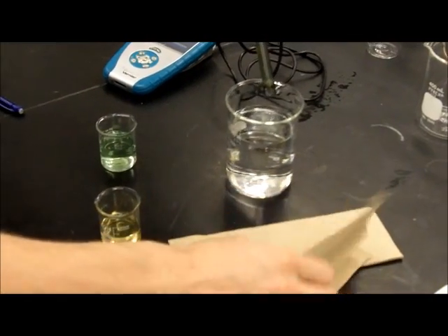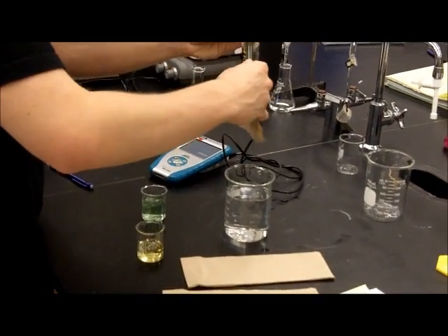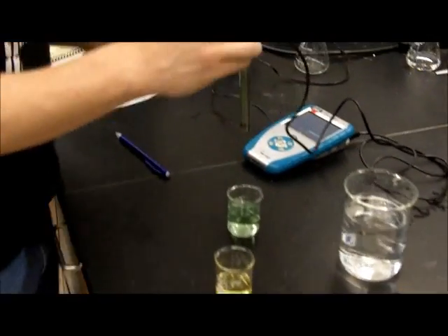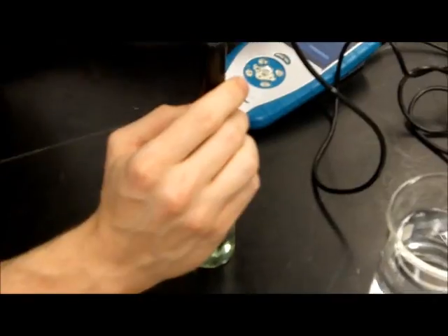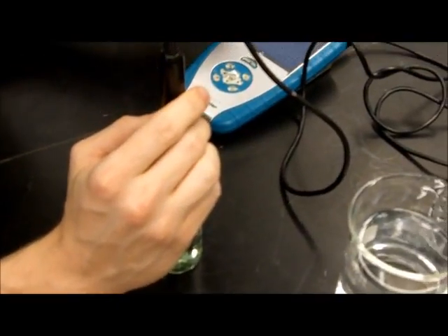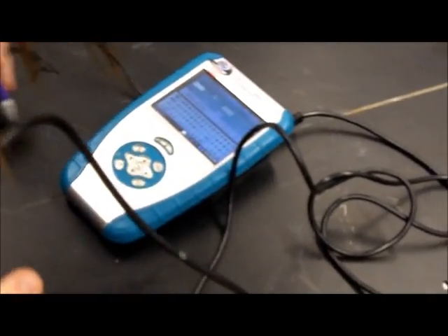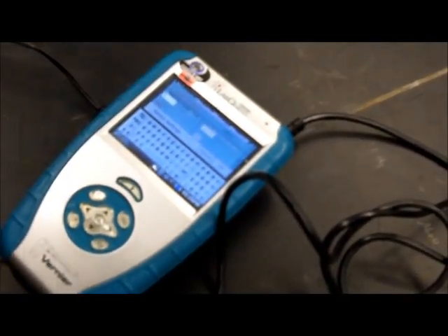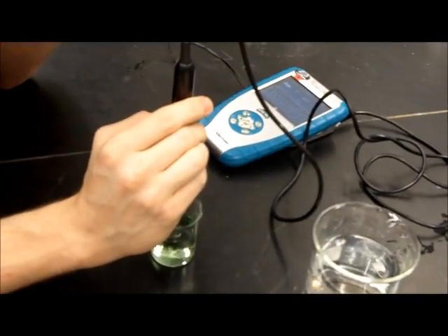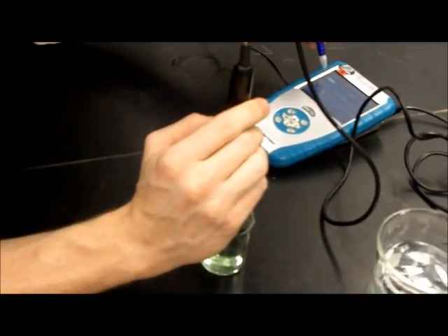Then we take our pH meter out of our distilled water, gently clean it off since the electrode is very sensitive, and stick it into a buffer solution. Carefully, too. This is of pH 7. So what we're going to do is hit calibrate now. We're going to put in our reading of 7 since that is known. And then we're going to keep it in there until the voltage reading up here becomes steady. Okay, it's about 1.67, 1.66 going back and forth, so we'll keep that.